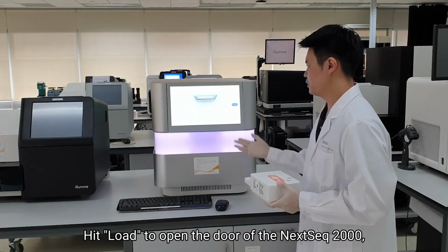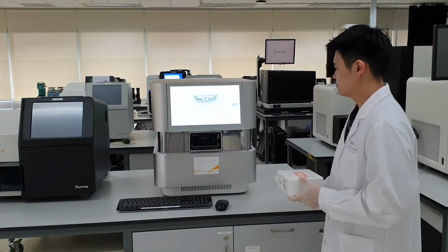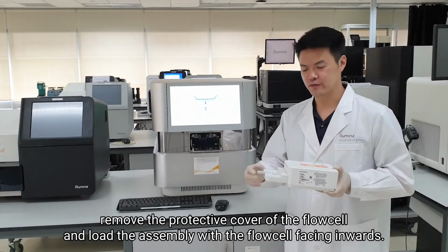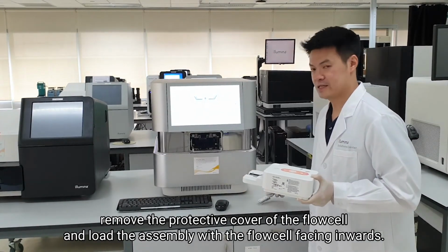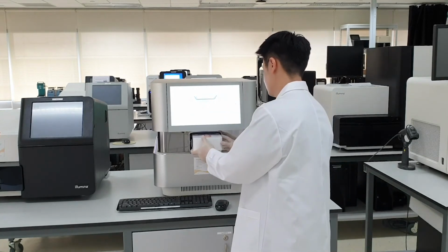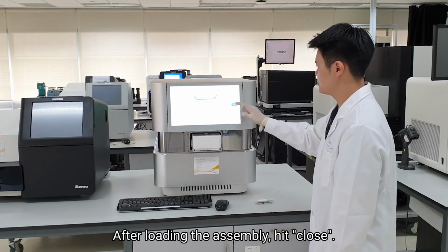Hit load to open the door of the NextSeq 2000. Remove the protective cover of the flow cell and load the assembly with the flow cell facing inwards. After loading the assembly, hit close.